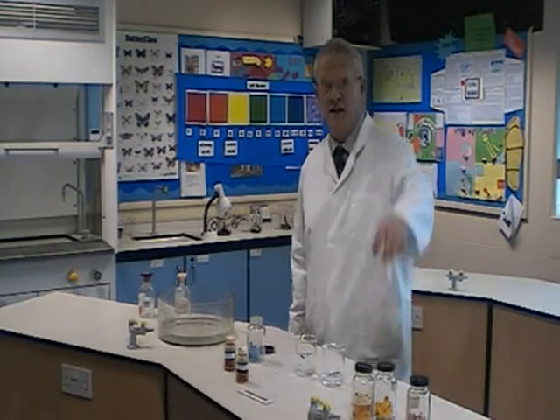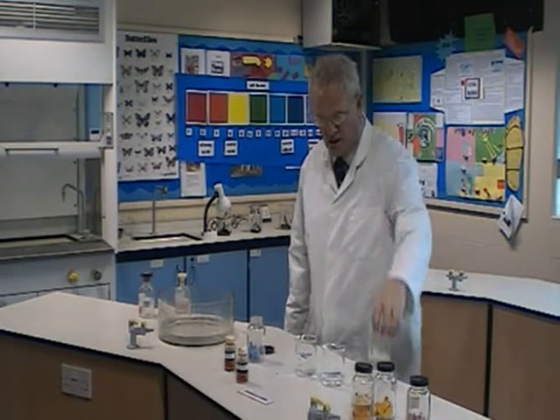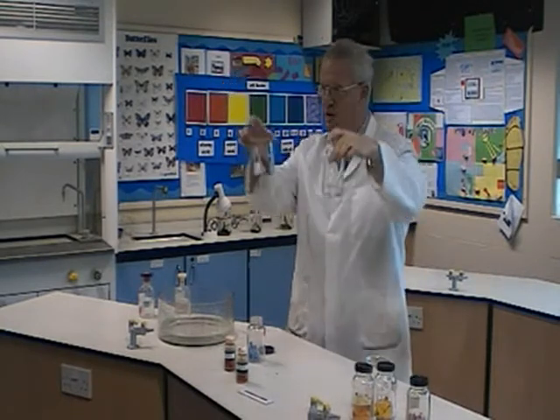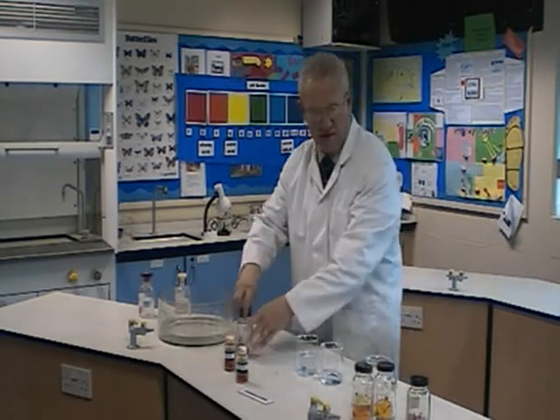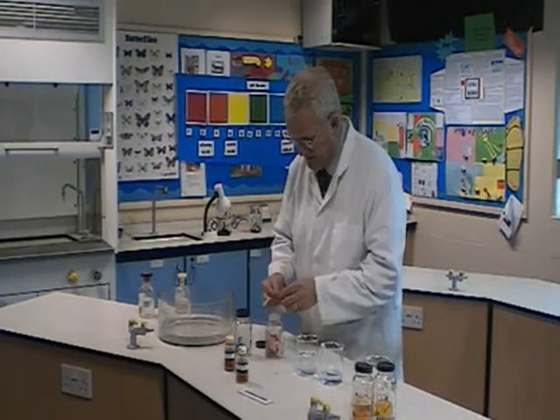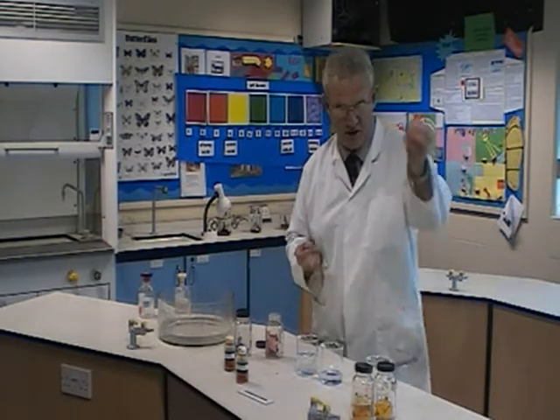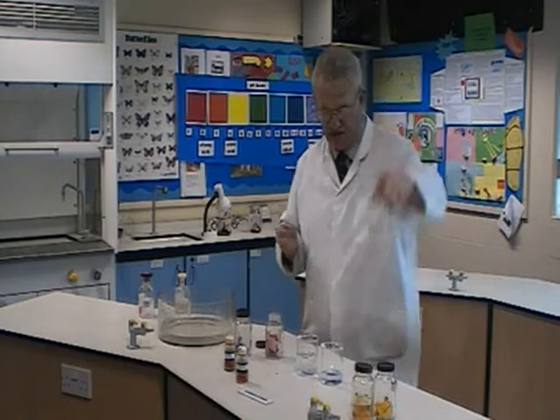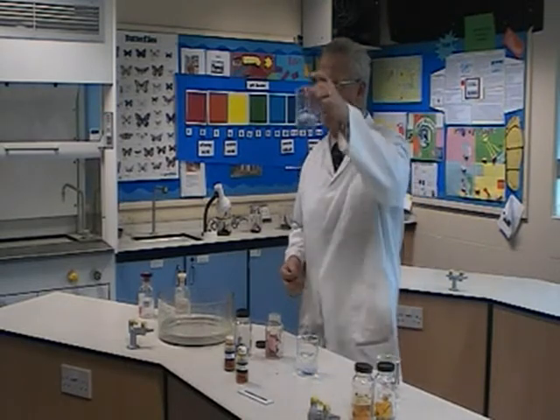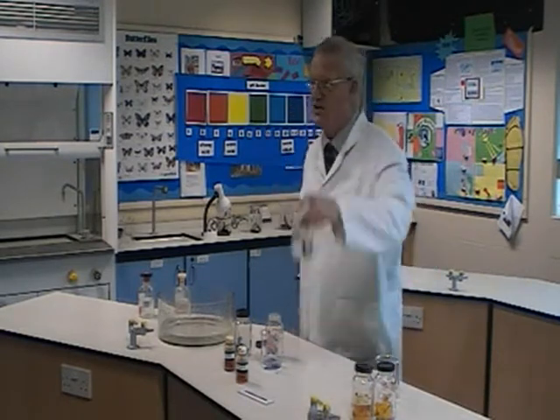Straight away that one turned red. We know that when blue litmus goes red, that's an acid, but we still don't know which one's the alkali. Now I'll get some red litmus paper and put it into each of them. It stays red to confirm that one is acid. But from the other beaker, the red litmus has gone blue — that's the alkali. And that should be the water, and indeed it is.